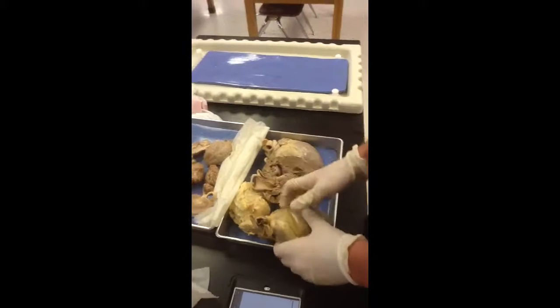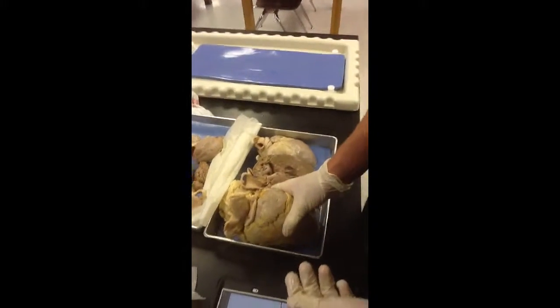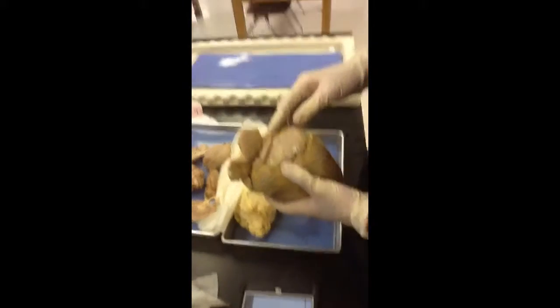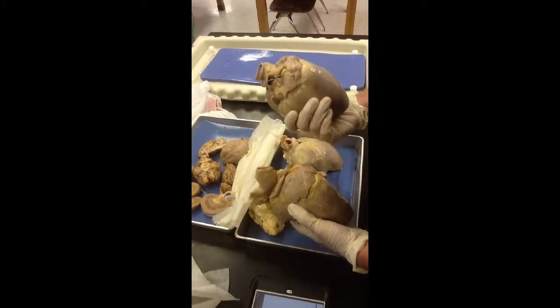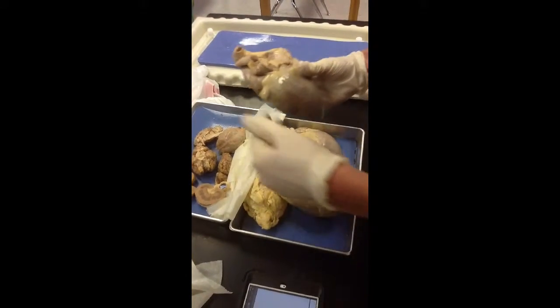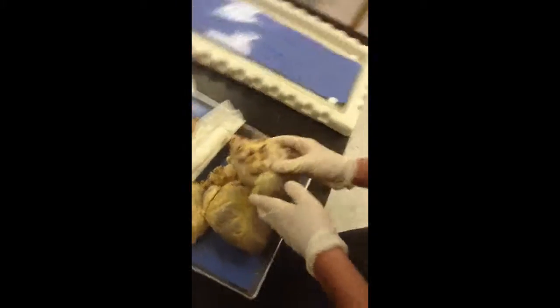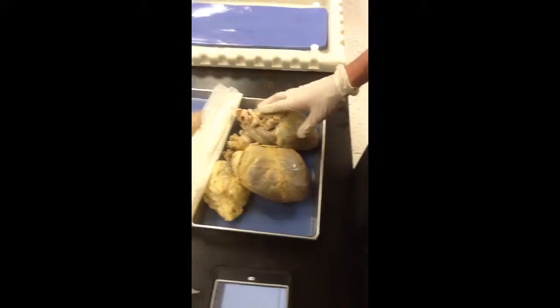And the pulmonary arteries. Inferior meaning less, like Corbin is inferior to Andrew. You have the right pulmonary arteries, I guess they run out right here, and the veins are on the left side that run into here, that run into the left atrium. Arteries go into the right atrium. No, wait, it's the other way around. It's the other way around. And that's it.